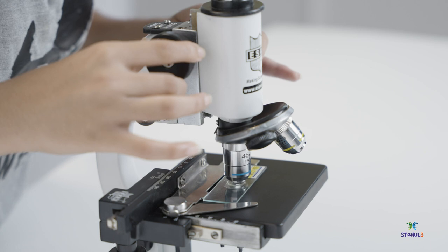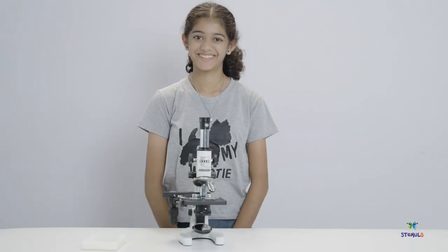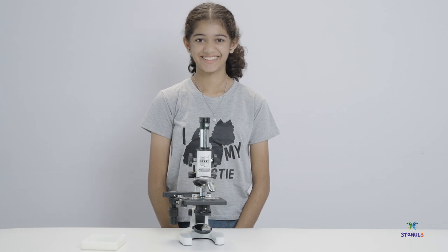On a higher magnification, your lens is closer to the sample. So did you enjoy using the microscope to observe and study your specimen?